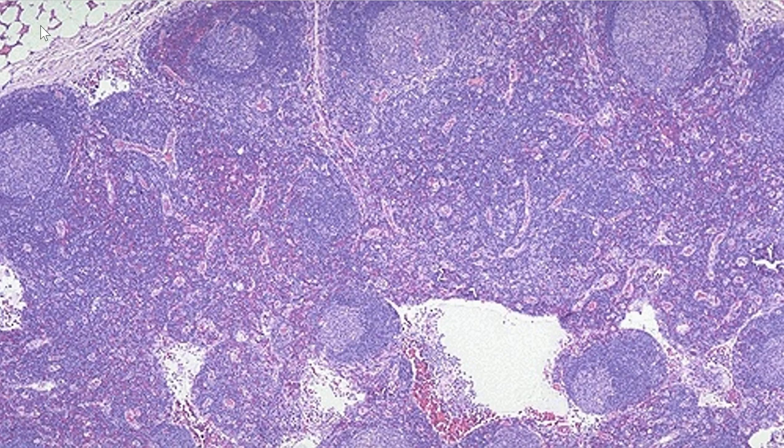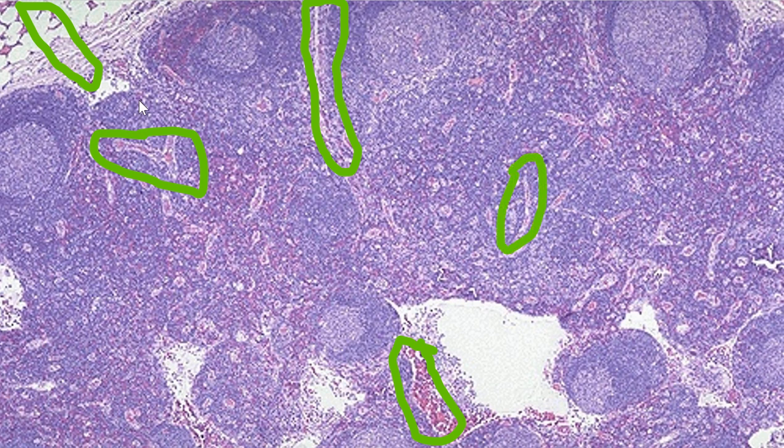In this image, you can see capsule here. And this is a nice trabeculae there. I kind of covered it up. Trabeculae here. Trabeculae here. There. So you kind of get the concept.